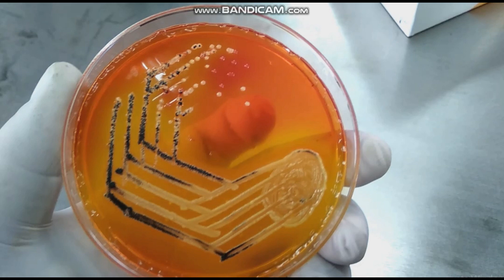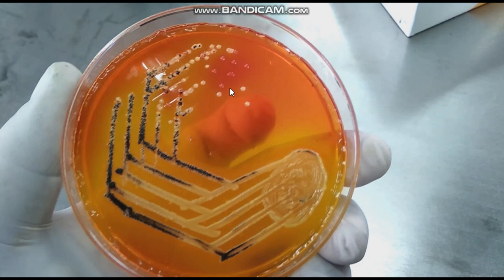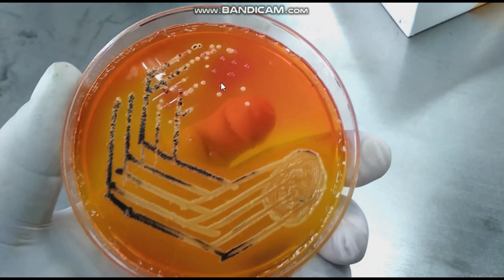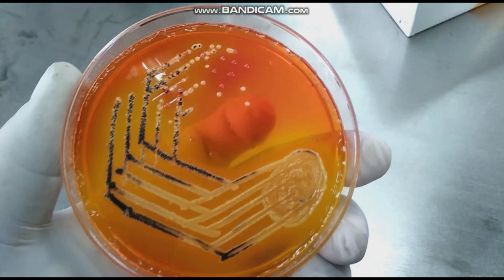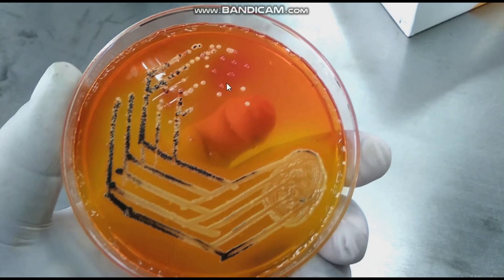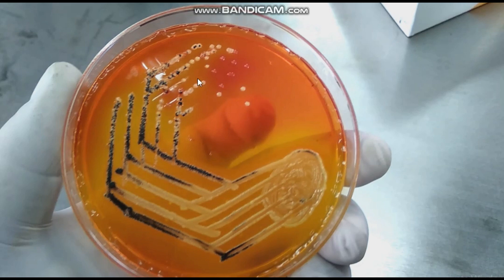One thing to note is that Pseudomonas can also grow on this medium, producing pink colonies. To differentiate Pseudomonas, performing the oxidase test can easily distinguish it from other organisms.